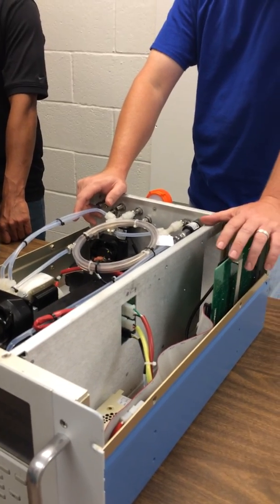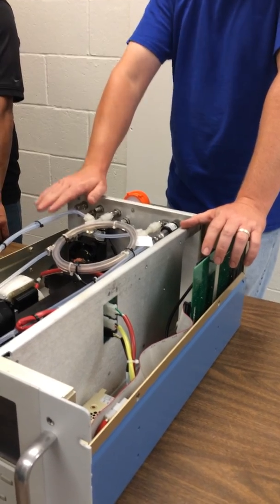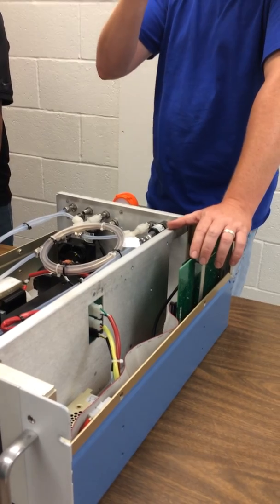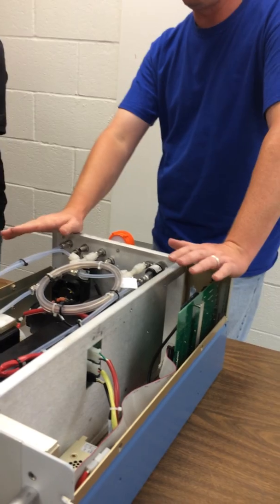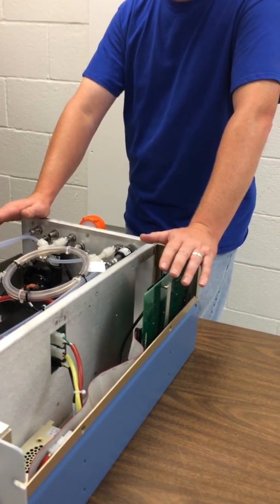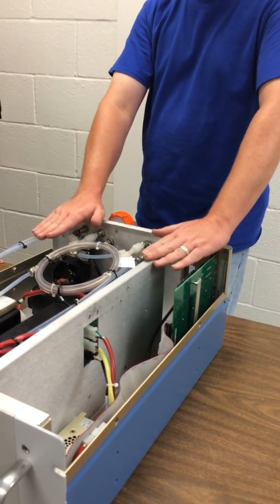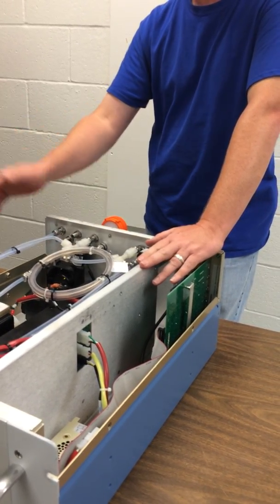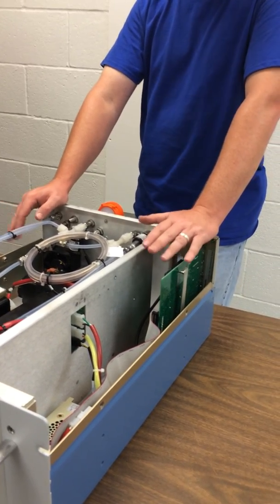So generally we reset about every hour. So we reset that baseline. And by doing that, we haven't let it walk very far. And so it's only a few, 5, 10, maybe 20 ppb difference. And at the levels that CO is, 20 is really a really, really bad one. Typically it's 5 or less. And we're okay enough with that to say that that data is good enough so we can send that data as it is off to TCEQ without having to go back and doing any post-processing on it and resubmitting it.